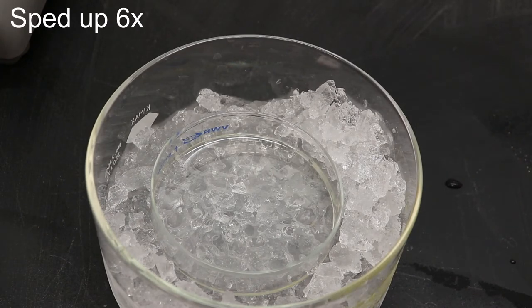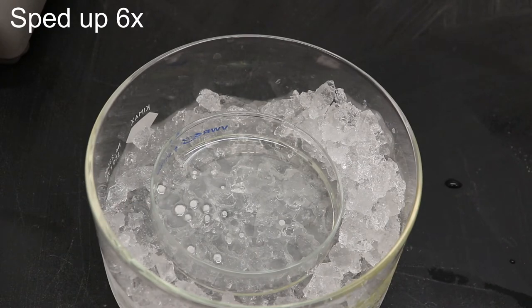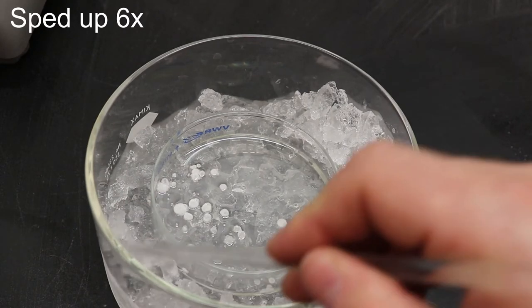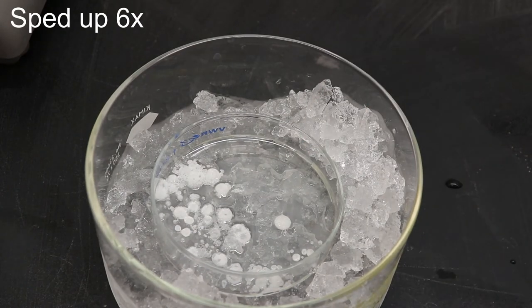Now see if you can spot the first crystals forming. All right, there. You see it? Right there. Just like that, there's a bunch more. Now I accidentally put this in lopsided so there's a deeper side and a shallower side, which you could probably tell by the way they're crystallizing.